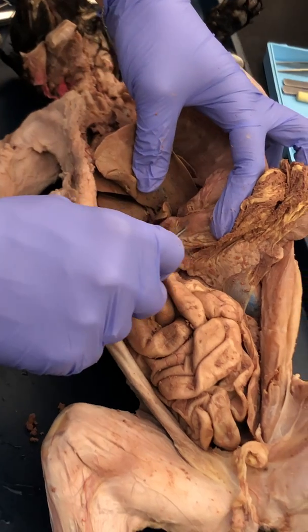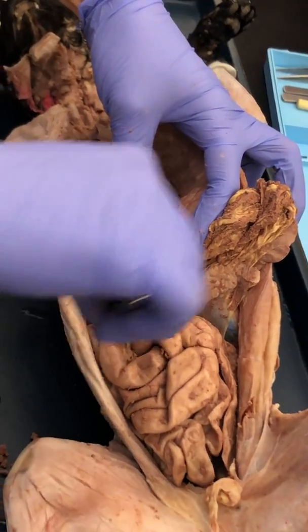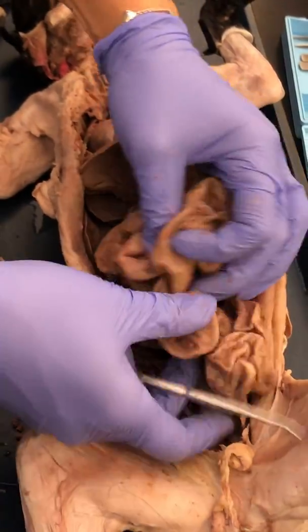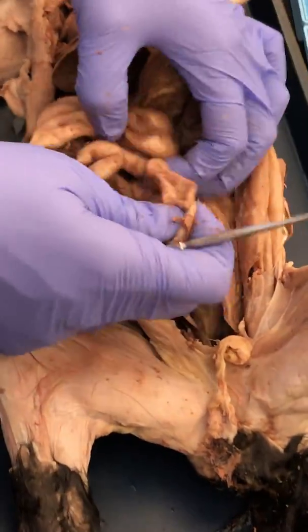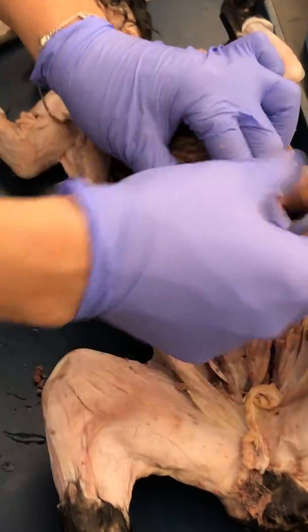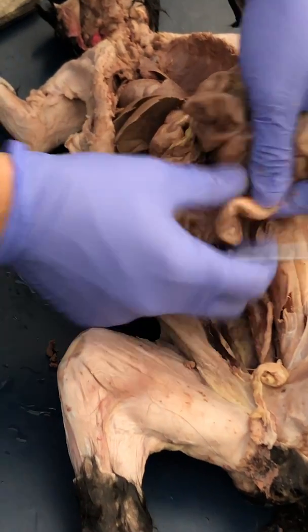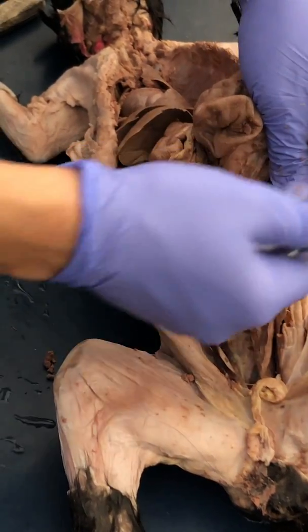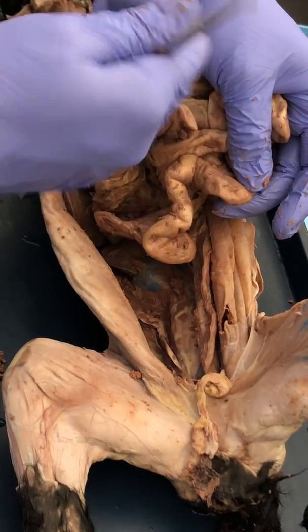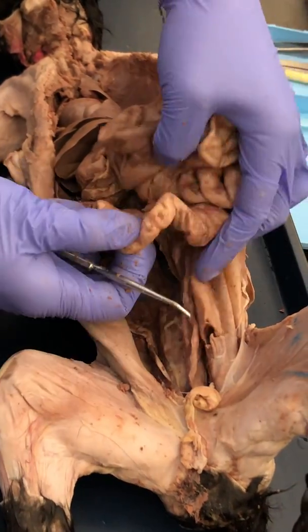So as we move out of the stomach into the small intestine, the first section is the duodenum. Then we travel through the jejunum until we get to, let me get to the large intestines. This is the transition, okay? So right before you move into the large intestine, okay, this is the ileum. So again, small intestine is right out of the stomach, is the duodenum, then the jejunum, then the ileum.